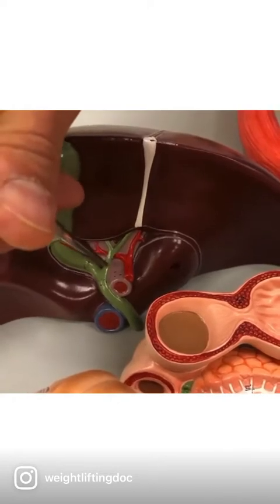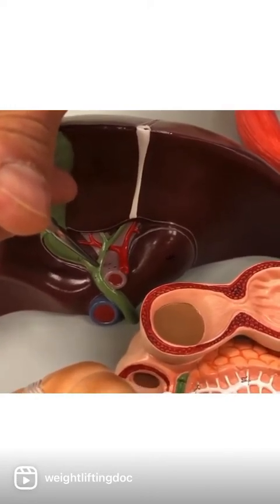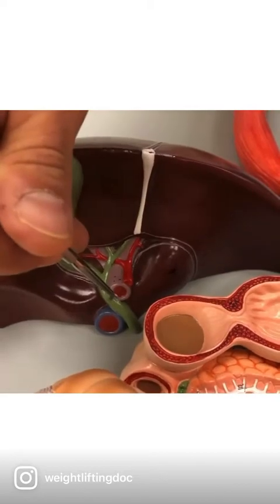And the common hepatic duct will then join with the cystic duct right there. And once they join, they are now called the common bile duct. So that's the common bile duct right there. Okay, that's the duct system.